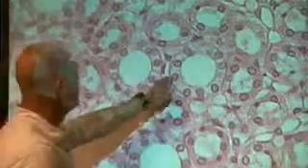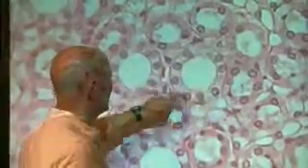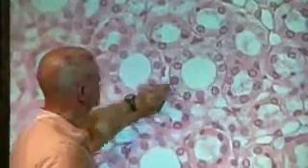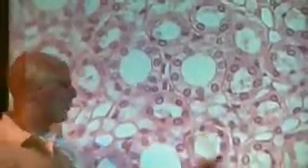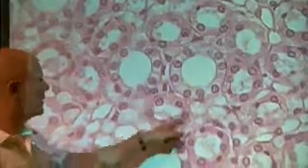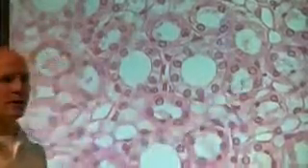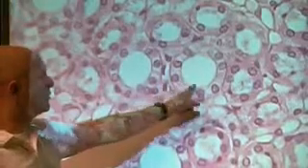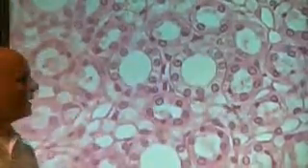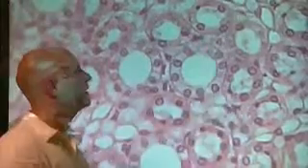you guys remember looking at slides where we looked at simple columnar epithelial slides, right? Okay? So when you see a tube looking like this, where you get that simple cuboidal epithelium showing up very nicely here, right? You see it shows up nice here, nice here, nice here on this one. Not so great on this one, right? Not so great here, not so great there, right? You guys seeing the difference between this tube and this tube, this tube and this tube? You guys seeing that? This is a collecting duct. This is a loop of Henle. Okay? So this is a collecting duct, that's a loop of Henle.